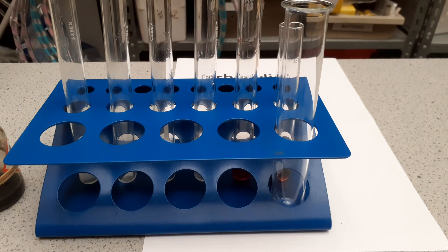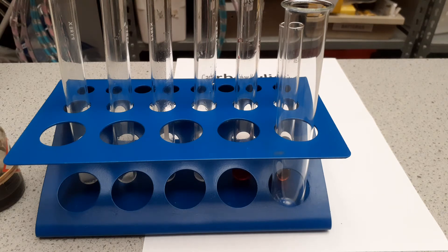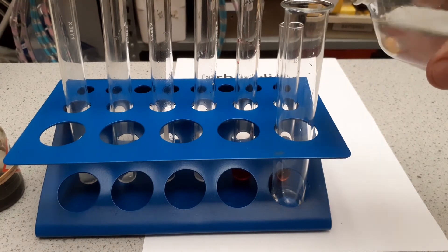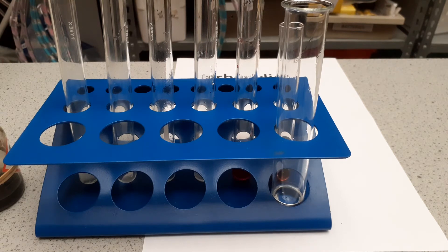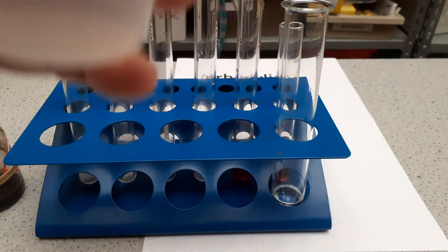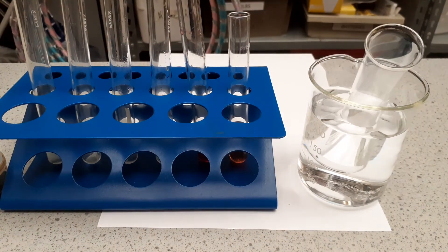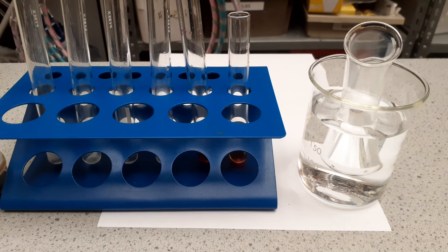The last reaction I want to look at is what we call esterification. To make an ester, we need ethanoic acid, and we add an alcohol — I'm going to use ethanol. To that, I'm going to add a few drops of concentrated sulfuric acid, which acts as a catalyst. Normally I would put this into a water bath on top of a Bunsen burner and heat it for about half an hour. At the end of that time, I'd have a sweetly smelling ester being formed.